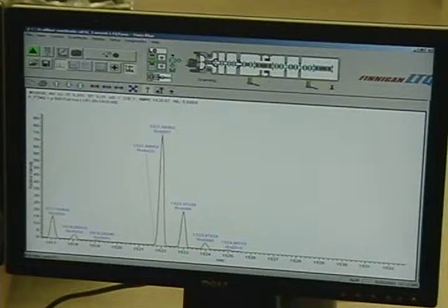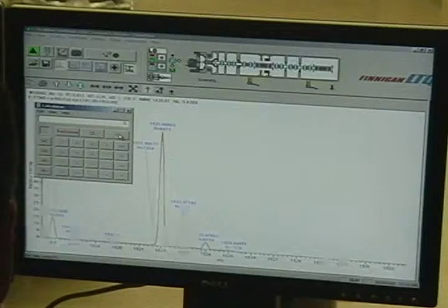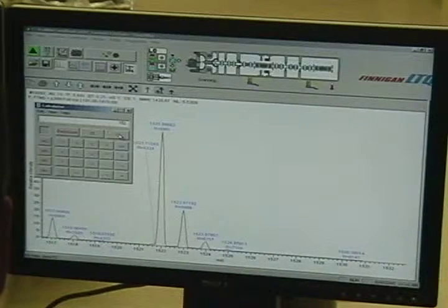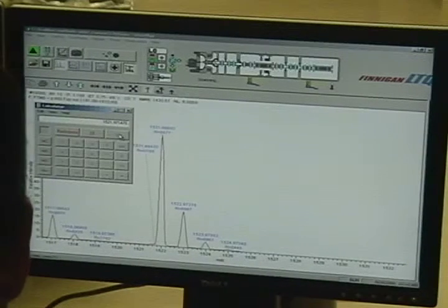That's weird. That's why I tell you, always do this. Okay, we need to do this from now on. Just keep an eye on it to make sure, because it'll pass. That was off by, it was 100 ppm. Yeah.